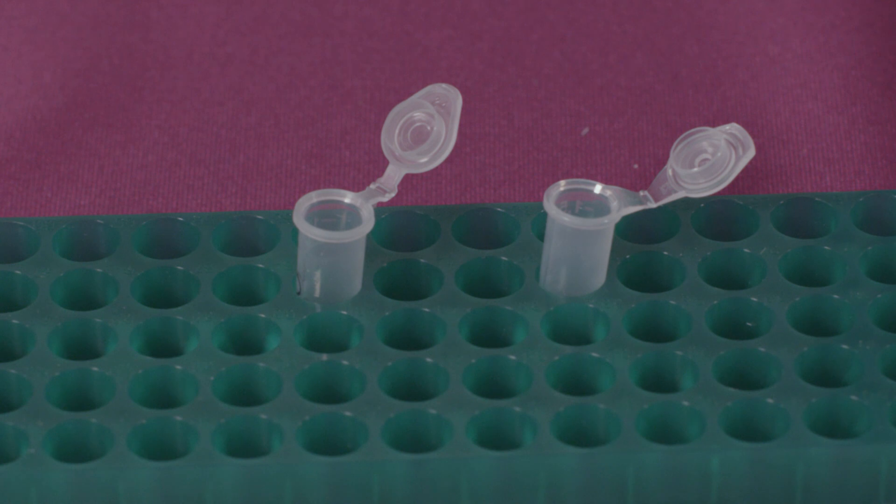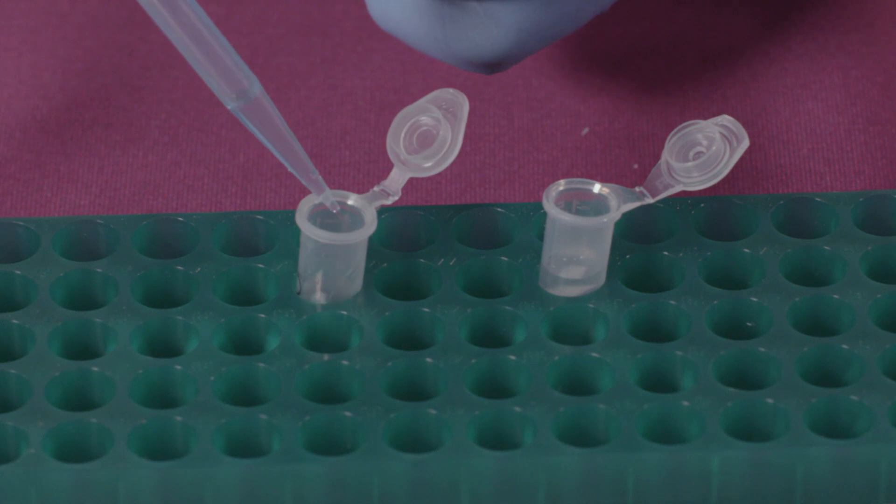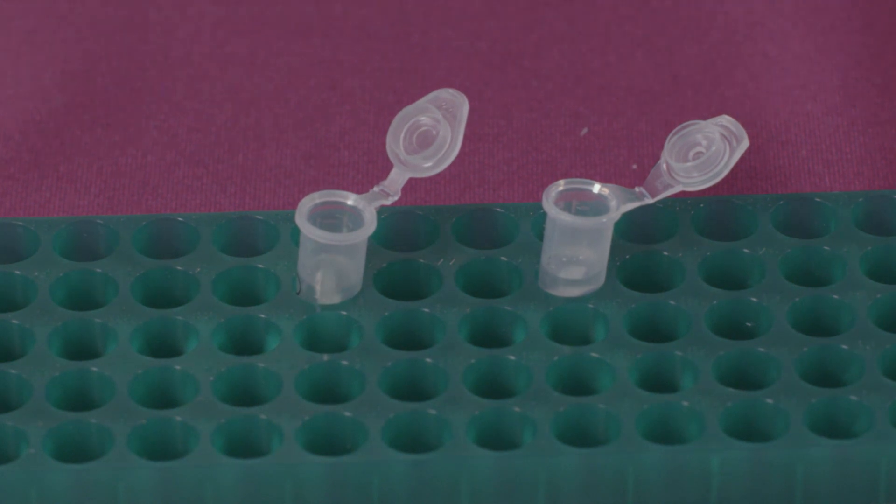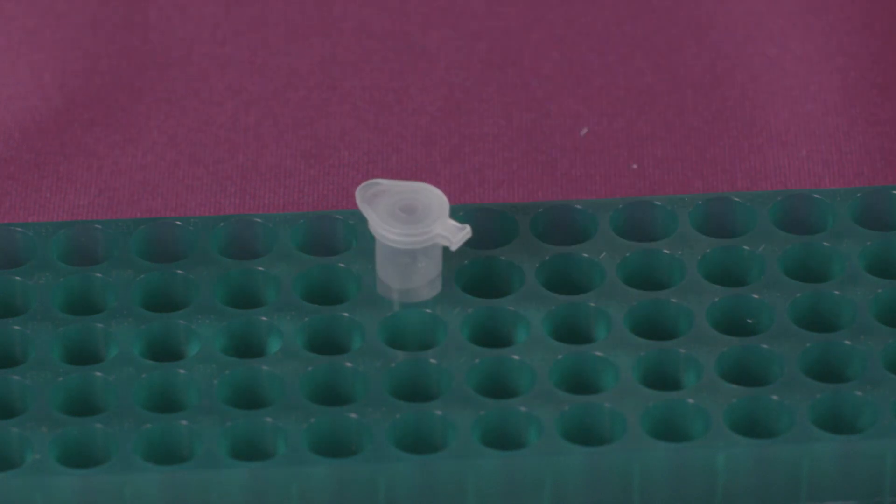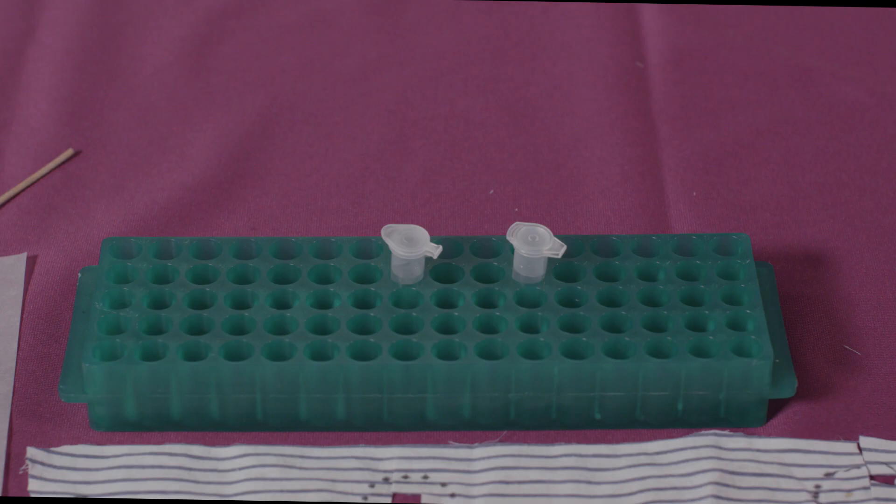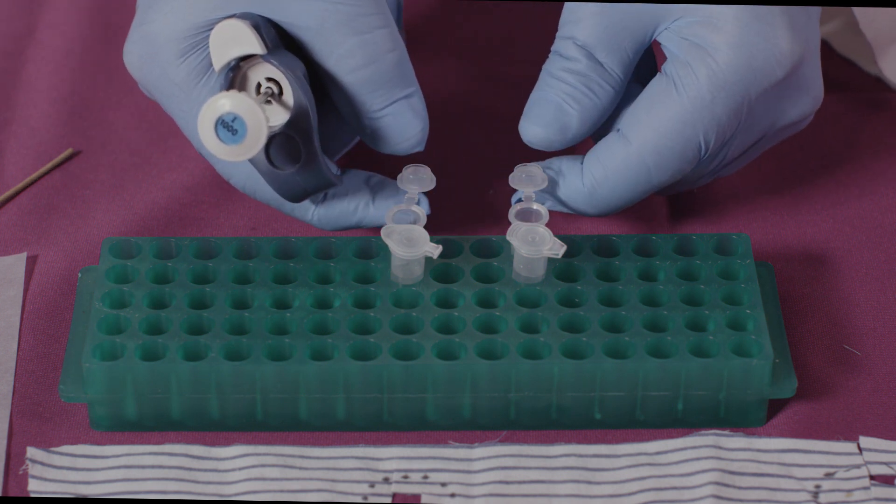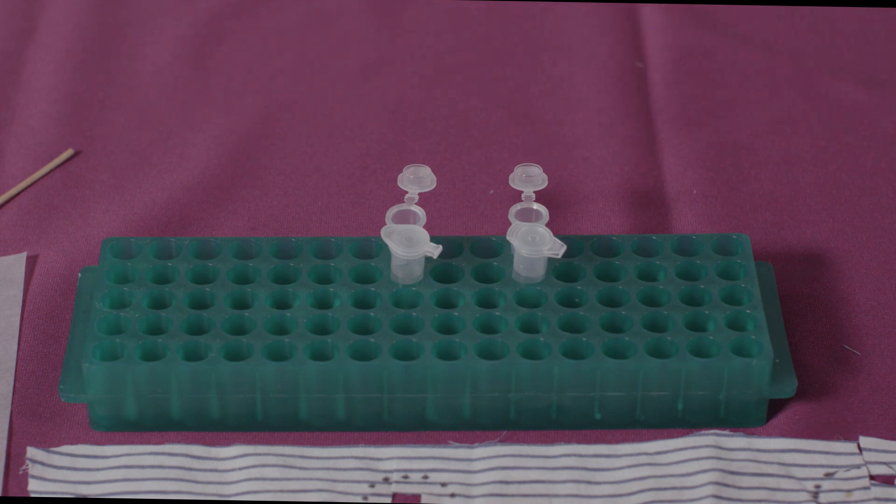From the supplied bottle of buffer solution, add one mil or 1,000 microliters of buffer to the tube. Extract at room temperature for 10 minutes. For those that wish to examine the extract for sperm, spin the microfuge tube at 3,000 rpm for 10 seconds.